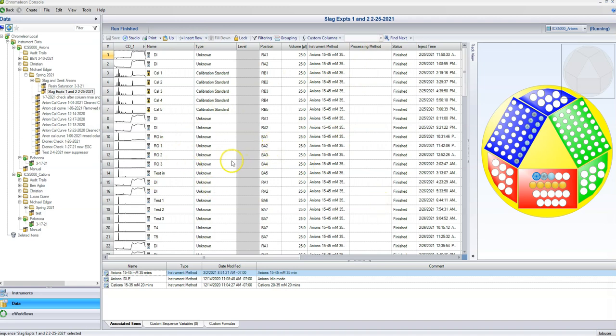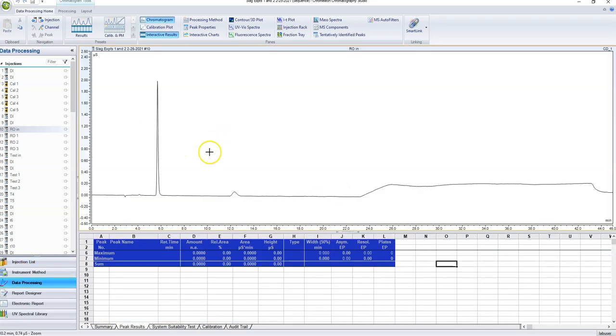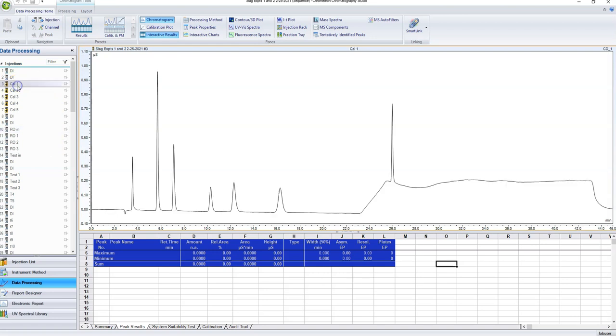Now, we can double click on any of these chromatograms that we have here and it'll open the data analysis software. So there are a lot of things here, but we are going to go through them one at a time.